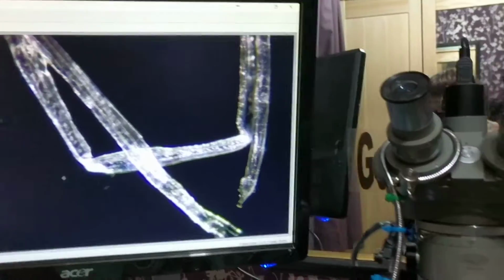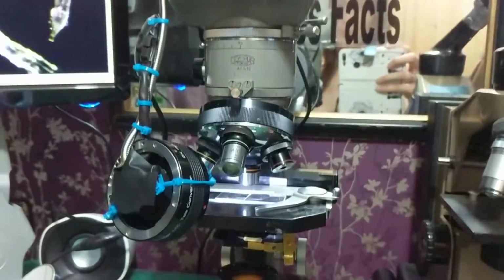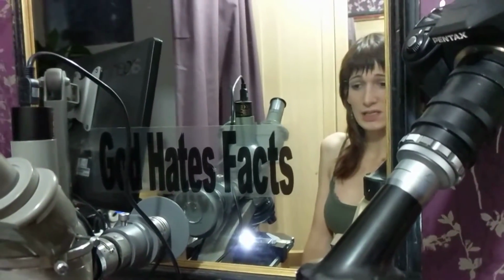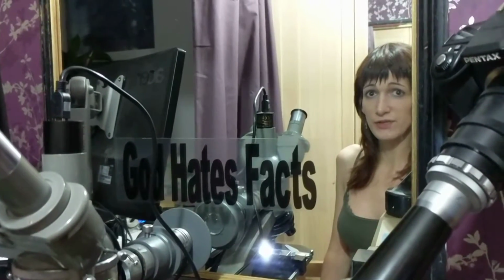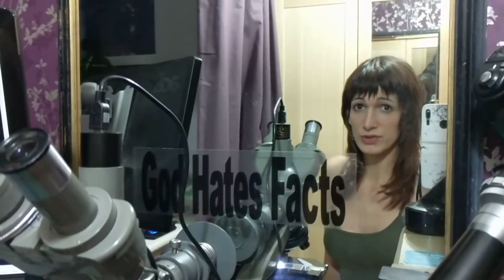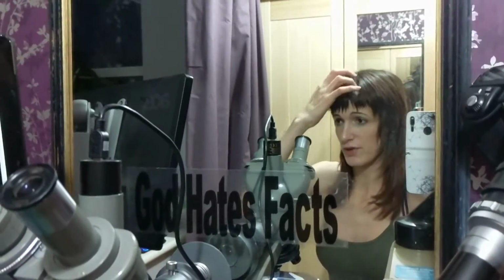So yeah, a little bit of DIY darkfield with a bit of messing around. That was quite fun. And yeah, I'm going to try and do some more of this kind of stuff. I've got a few more bits and pieces coming out, different condenser. So an Abbe condenser, which I picked up off eBay for about £10. So I'm going to try and do a bit of darkfield from the bottom, which was the original idea, but I didn't have the right condenser.